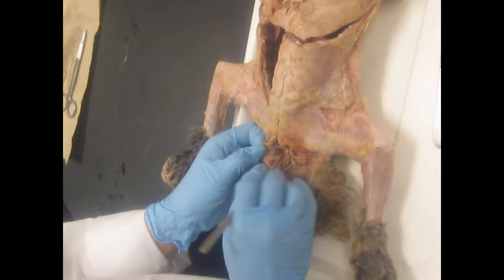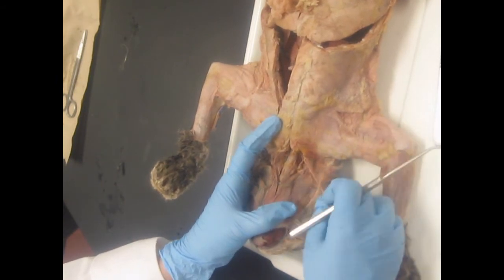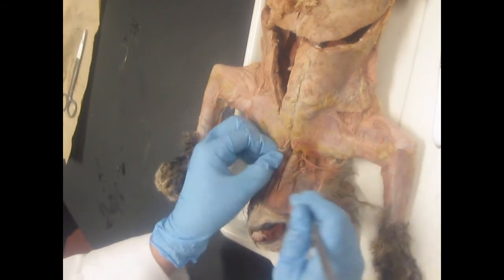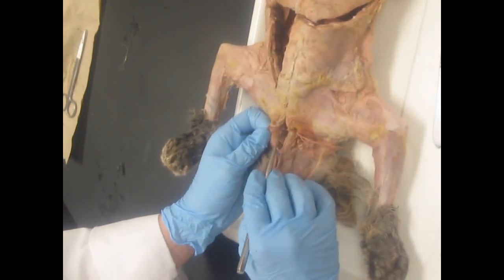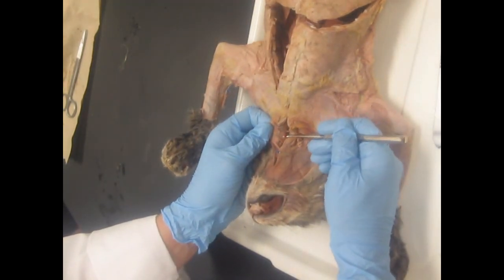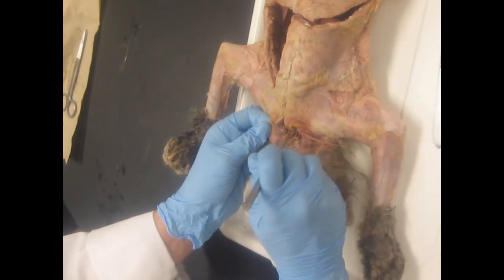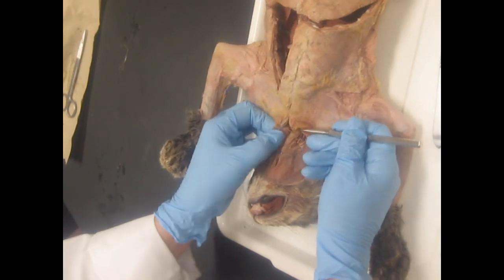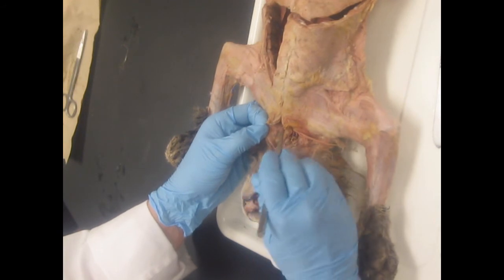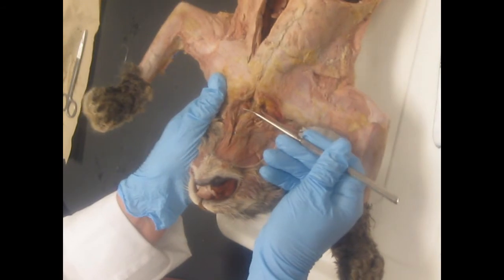Okay. Now I'm going to start on the left side because the problem with the right side is that's where they make their incision to put paint into the head and limb area, and oftentimes that thyroid gets damaged over there. But on the left side, it's going to be right next to the trachea, and it's going to be an elongated brown glandular organ right there. Kind of use your probe as a hook, and it's shiny. Now you can tell the difference between this gland and the muscle because the muscle will look stringy because of its fibers and its fascicles. That's the thyroid gland. Okay.